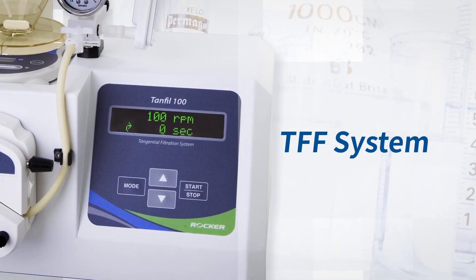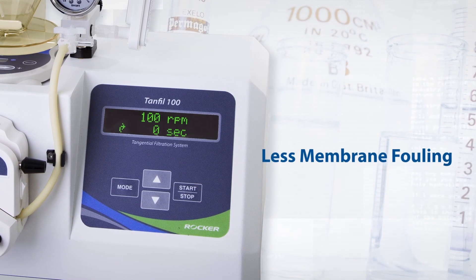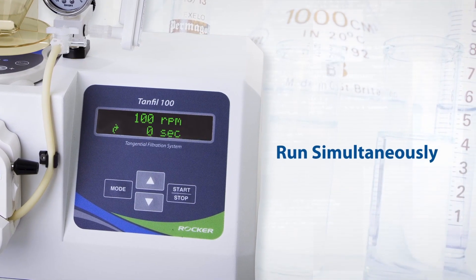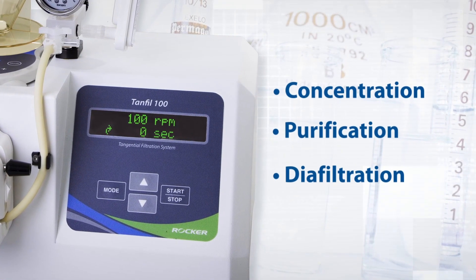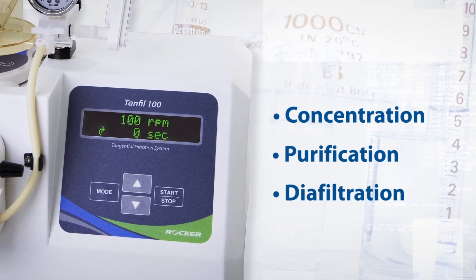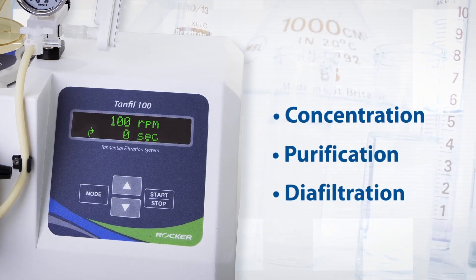As compared to traditional dead-end filtration, TFF method reduces membrane fouling. It also concentrates, purifies, and diafilters at the same time, speeding up and simplifying the process.